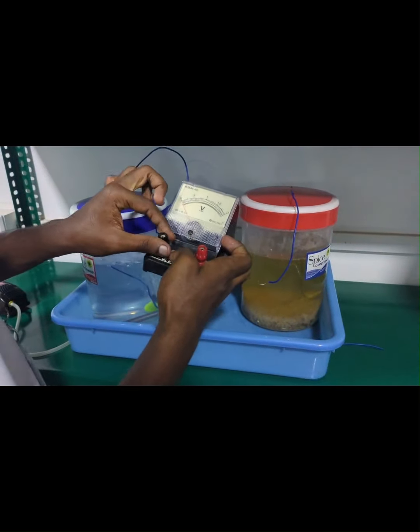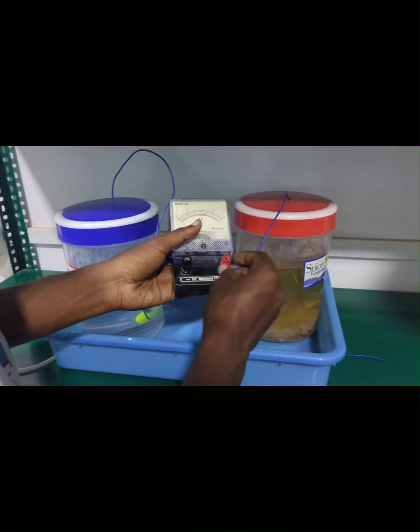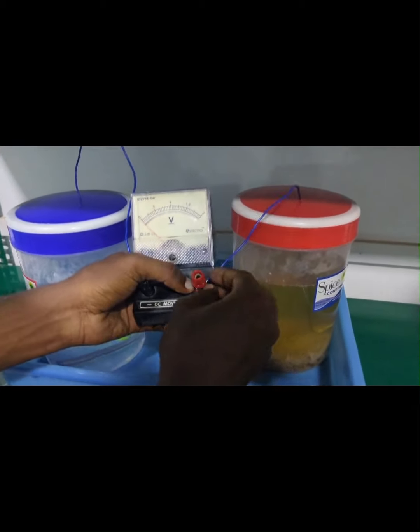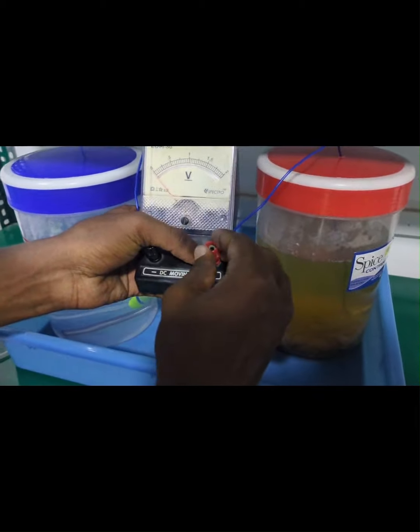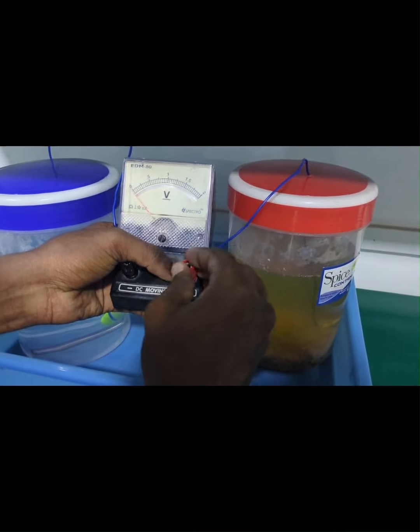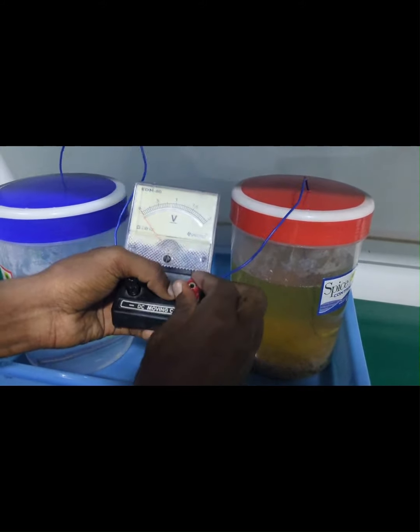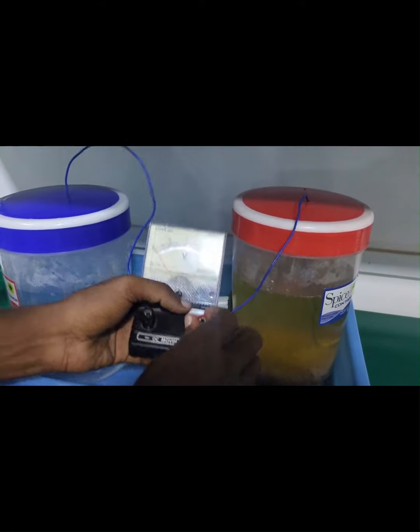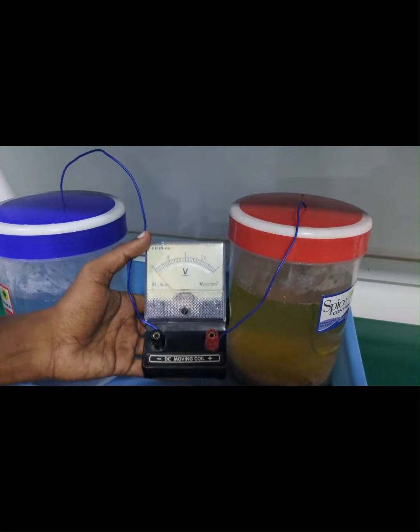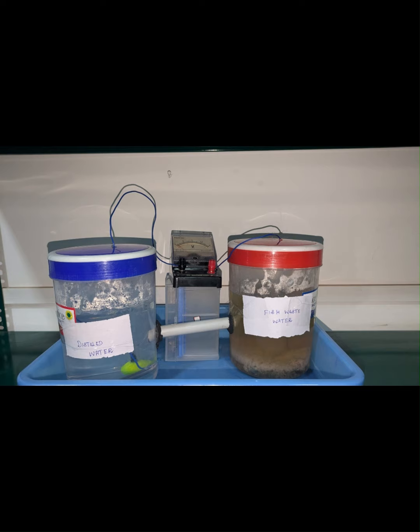In the container having distilled water, an artificial aerator — similar to those used in aquariums — is attached to maintain aerobic conditions, whereas the fermented water container is maintained under anaerobic conditions.